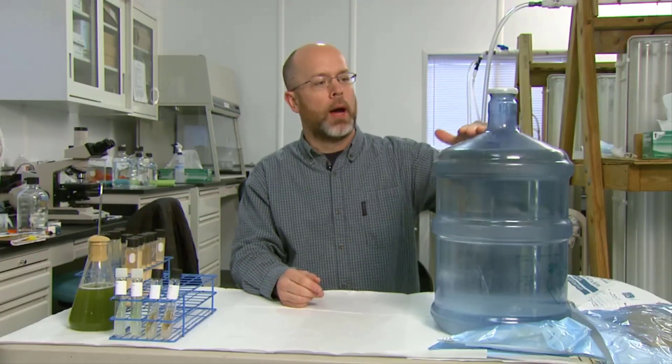We don't want our culture all the way up to the top of the carboy — we want some room for aeration and that kind of thing. So the first thing we need to do is pour off some of this Clorox water prior to neutralizing it with sodium thiosulfate.